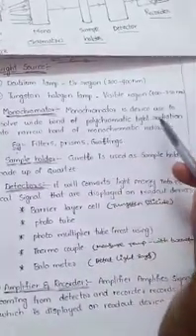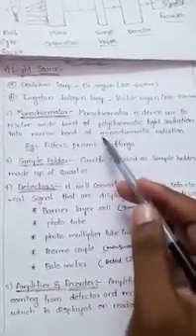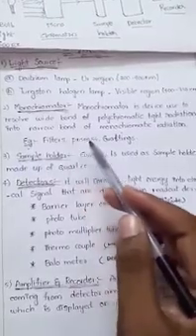The second part is the monochromator. Monochromator is a device used to resolve a wide band of polychromatic light radiation into a narrow band of monochromatic radiation — converting polychromatic light into monochromatic radiation, that means bulk rays into single rays. Monochromator example materials are filters, prisms, and gratings techniques, which you already know from physics.